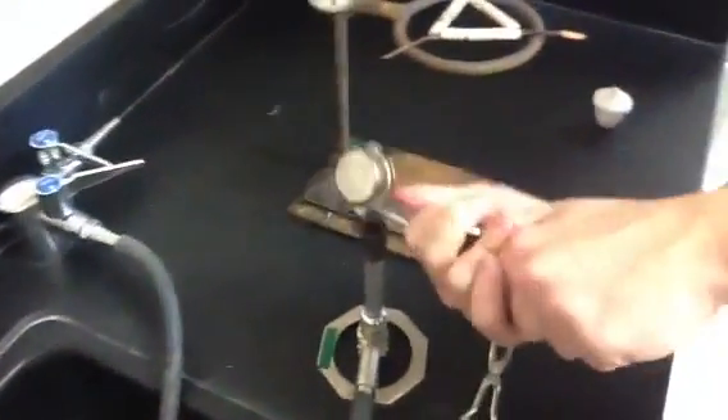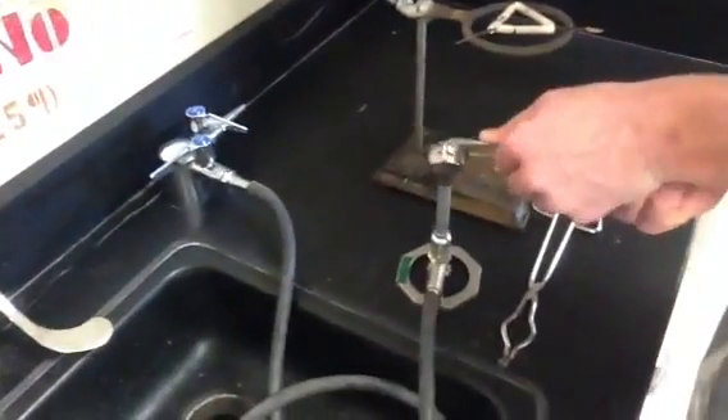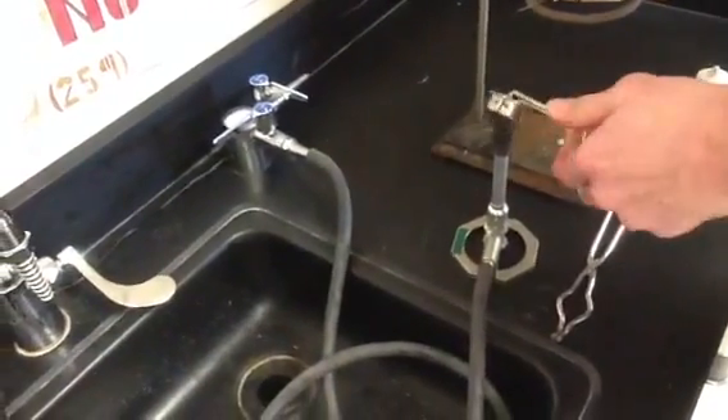We're going to blow up with the amount of gas in here. Let's clear up the gas because we're probably going to need to take something else's igniter. No — we got this, it works. Here we go. This is probably the hardest part of the experiment, folks.